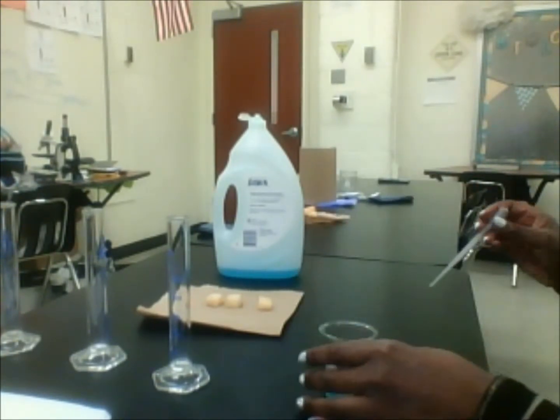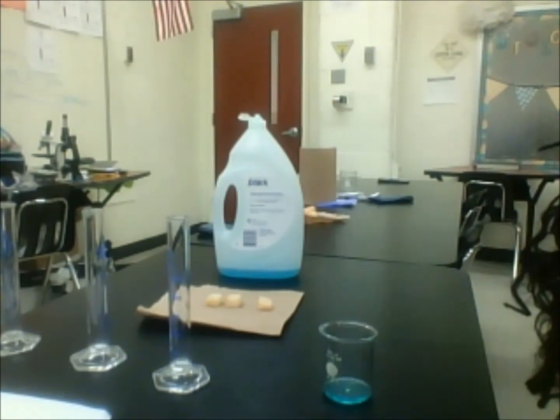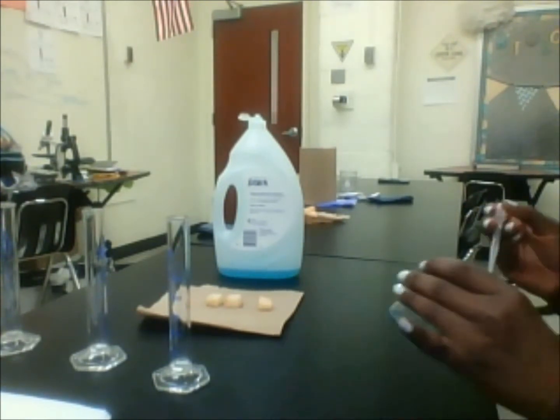I sent my supervisor those pictures and asked if he could come up with something for this lab, and within the next couple of hours he sent me a good lab write-up. I modified it just a little bit. I also looked at one of the videos I saw on YouTube, so I blended those two together, and this is what I came up with.